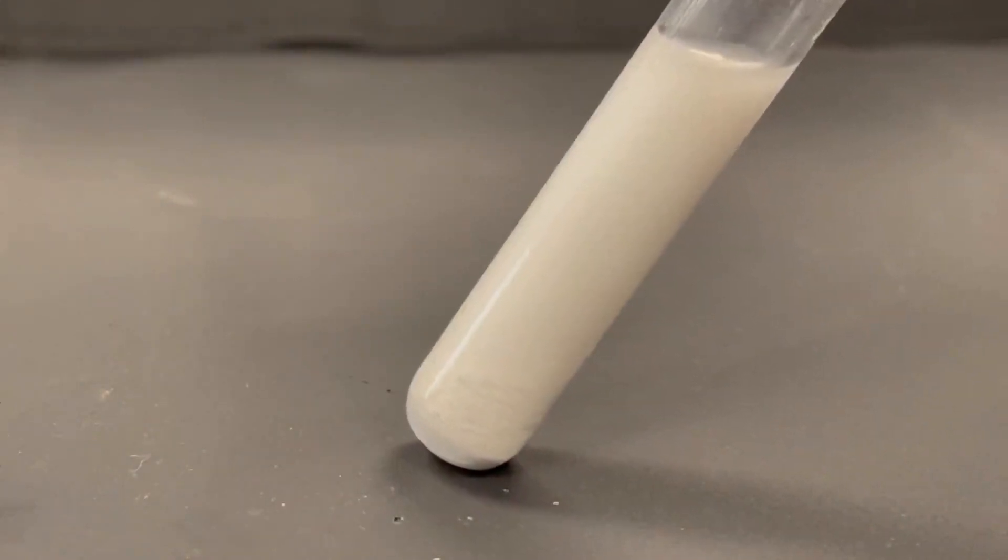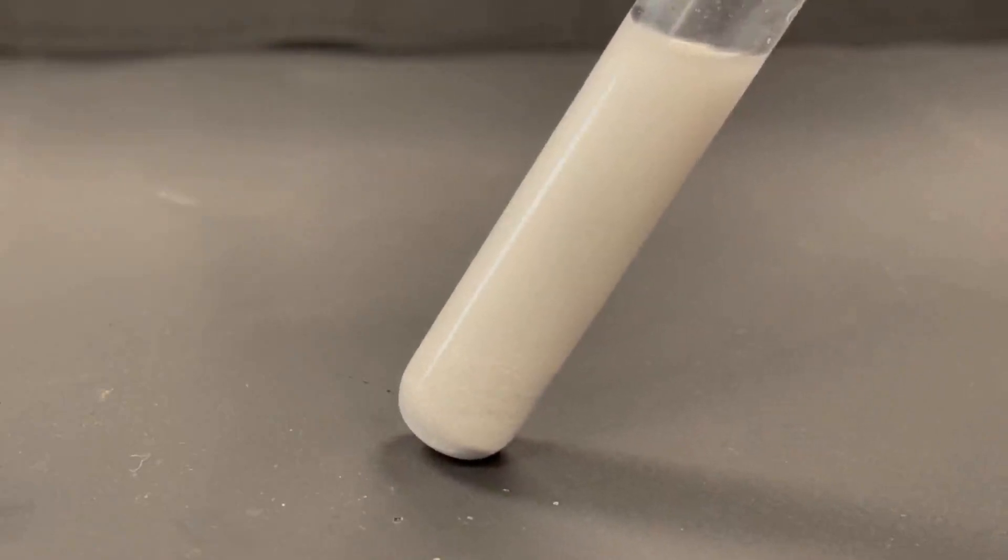After the test tube has rested for some time, we can see that the solid white precipitate has begun to settle at the bottom of the test tube.